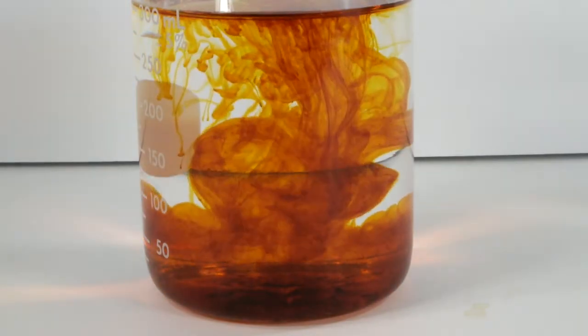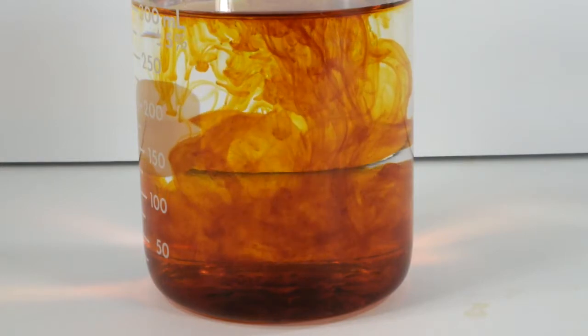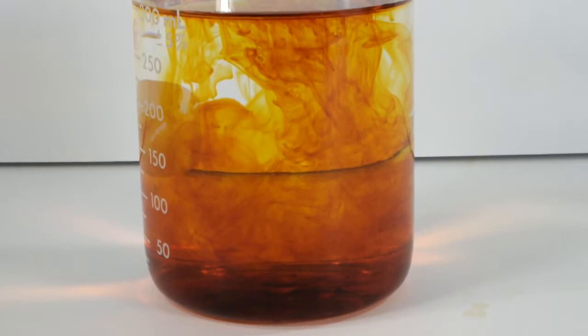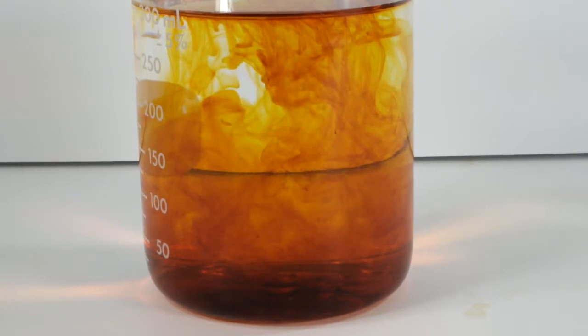As it dissolves, the solution takes on an orange color that borders on red. I almost hate to stir it. Oh, okay, fine.